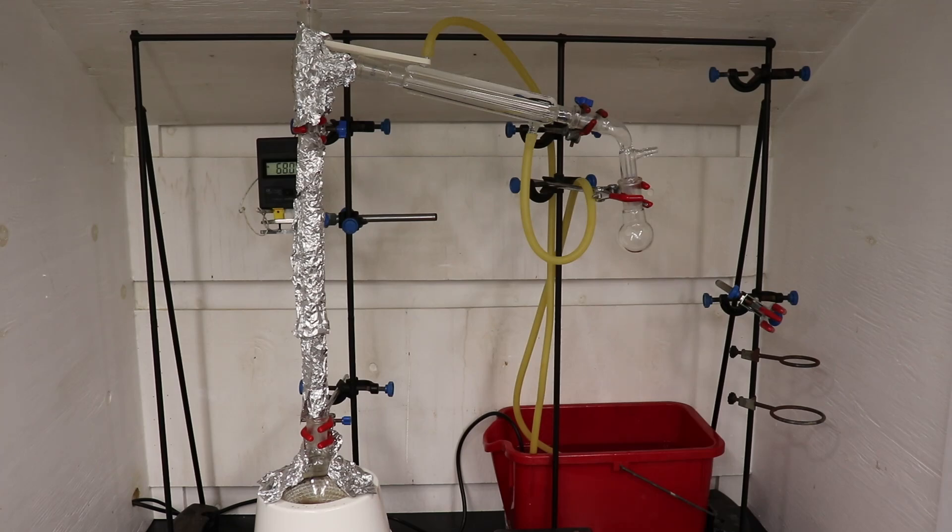Now with the clean setup assembled, the heating was turned back on, resuming the distillation. At this point, the only things remaining in the distilling flask, is the ethyl-2-bromopropionate, para-toluenesulfonic acid, which is not particularly volatile, and any unknown impurities. Knowing this, I just cranked up the heating on the mantle, allowing me to rapidly distill over the product.